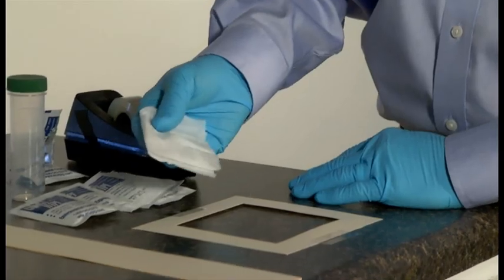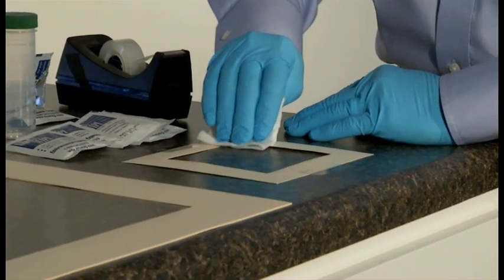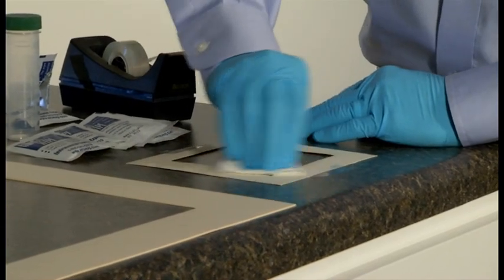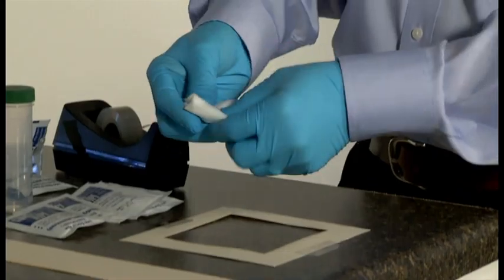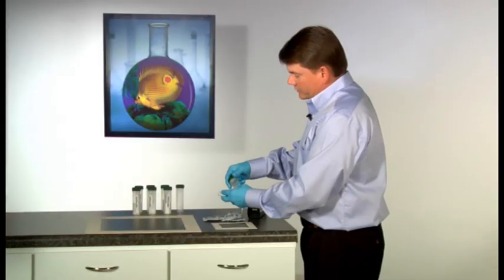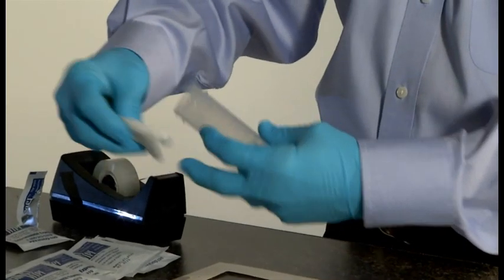Repeat one last time in an S fashion, concentrating on the corners. Fold the wipe one last time and place in a rigid wall container for shipment to the laboratory.